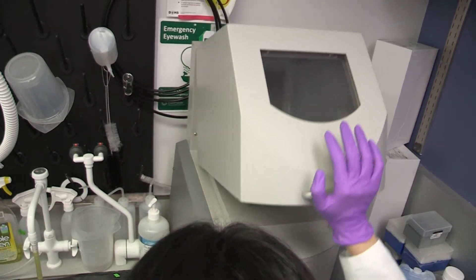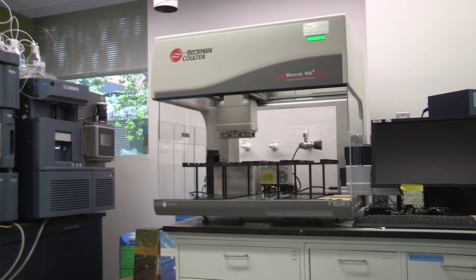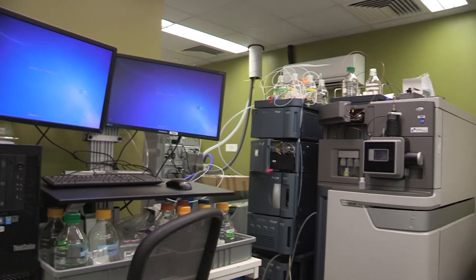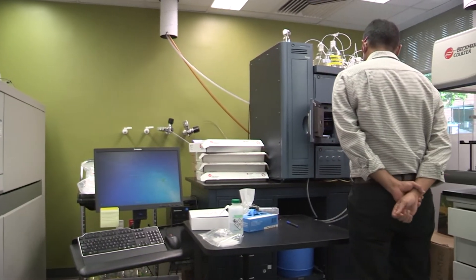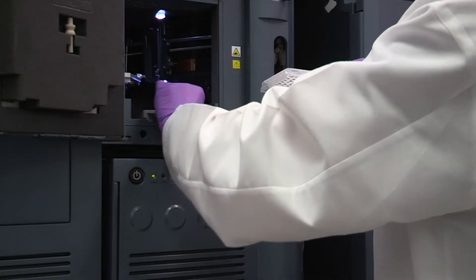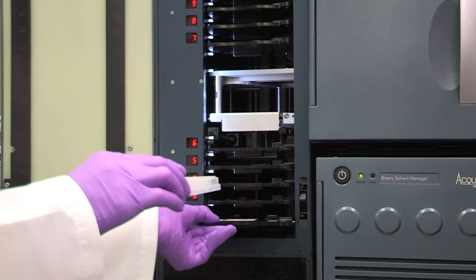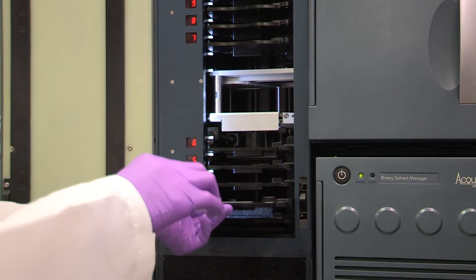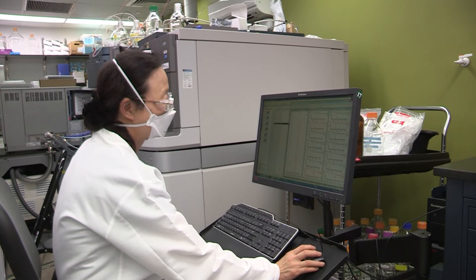We use a tissue homogenizer to homogenize tissue samples in 48-well plates. Plasma and tissue homogenate samples are then prepared by protein precipitation in 96-well plates for analysis. The BioMek liquid handler is used to transfer supernatant. We use control blank biological matrices for calibration standards and quality control samples to quantify PK samples. Drug concentrations in samples are analyzed by UPLC-MS/MS. We have two UPLC-MS/MS instruments: the Waters Xevo TQS and the SCIEX API 7500. We optimize UPLC and MS/MS conditions to improve sensitivity and selectivity. The UPLC-MS/MS methods are transferred to CROs for GLP toxicokinetic studies when compounds have advanced to late stages of preclinical drug development.